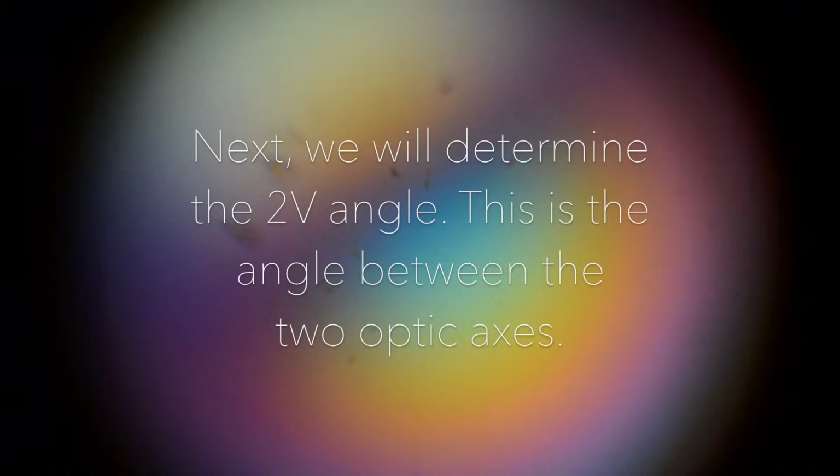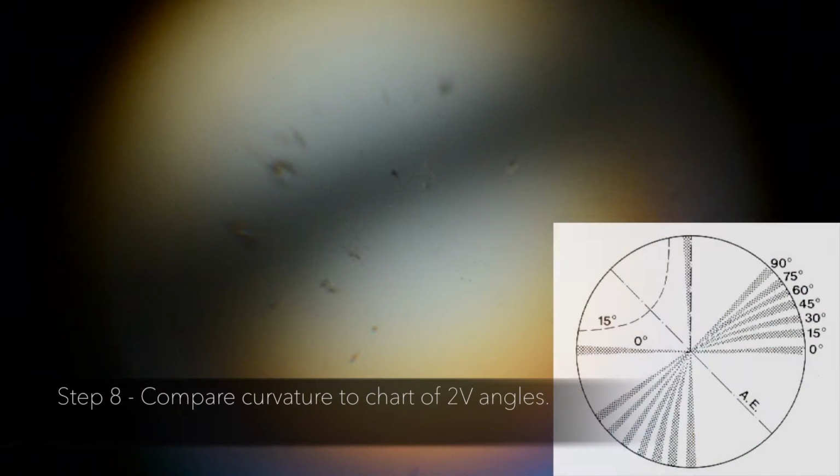Next, we will determine the 2V angle. This is the angle between the two optic axes. We can determine the angle by examining the curvature of the isogyres. Step 8. Compare curvature to chart of 2V angles.